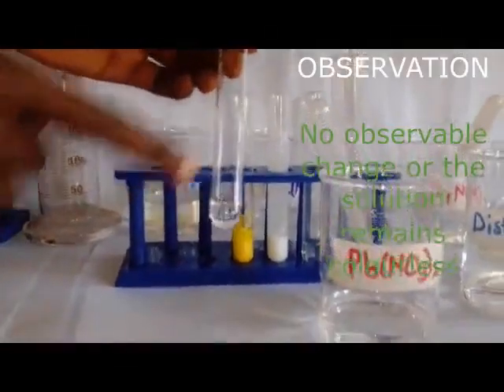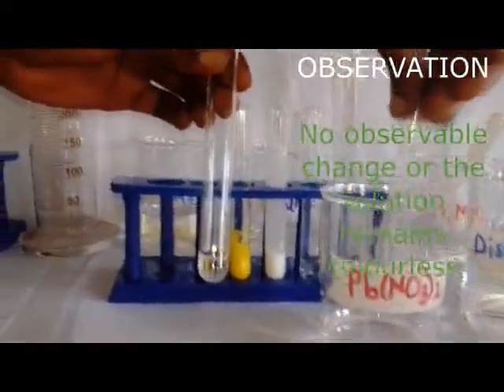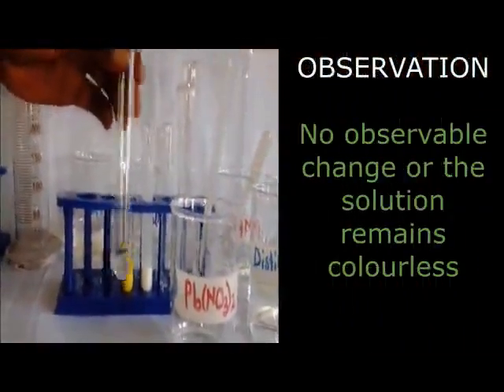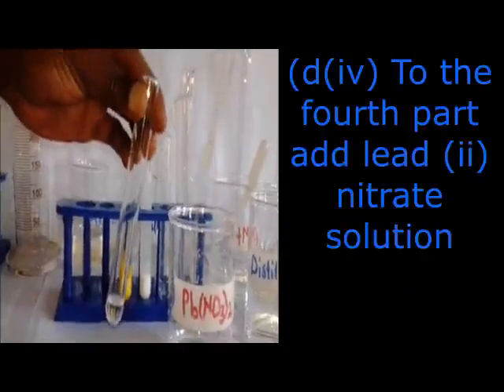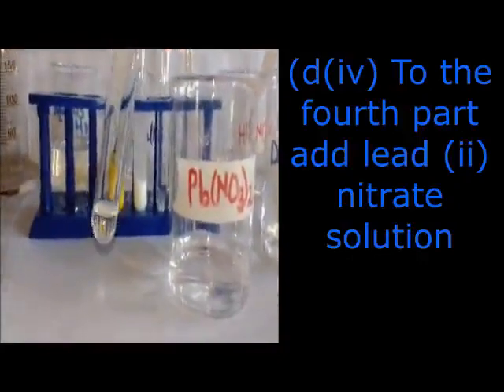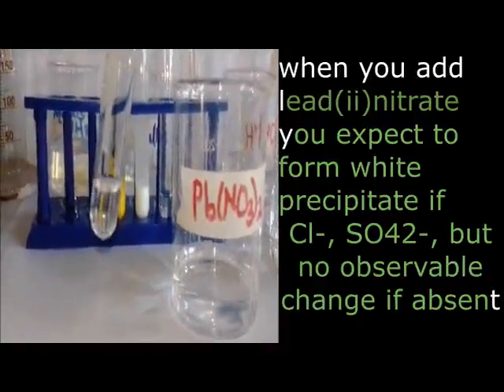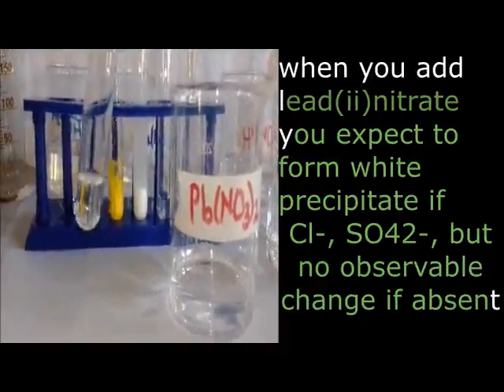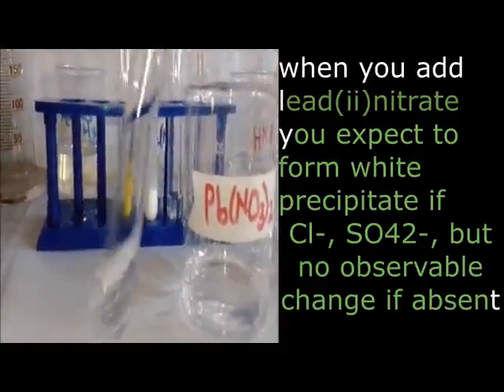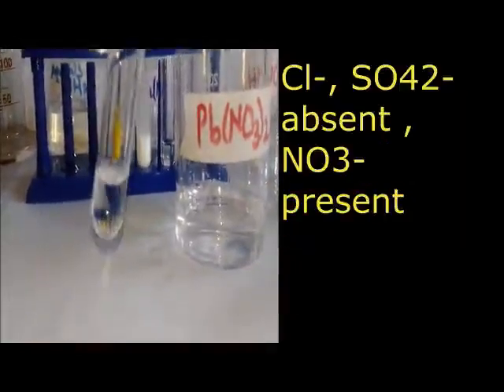So you can see, what have I added? I've added lead nitrate. What am I going to conclude? I'm going to tell the teacher the solution remains colorless. That is what I'm going to record. Lead nitrate always forms a white precipitate if sulfate and chloride are present.